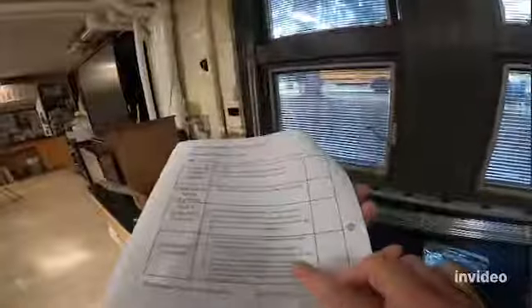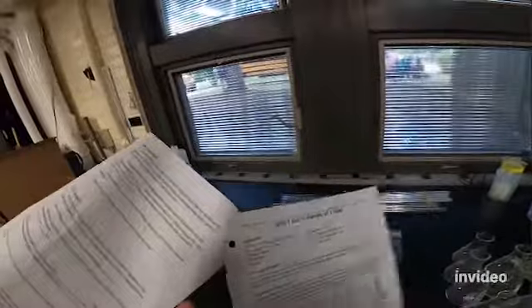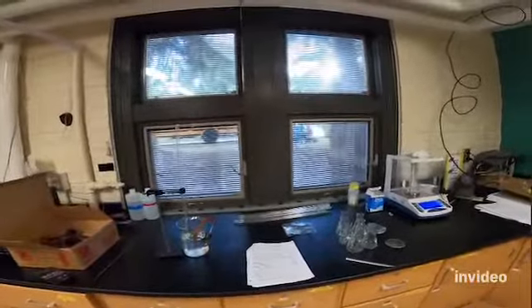Okay, if you're not sure what percent error is, you might want to Google that, and it will show you how to calculate it. Okay? All right, guys, that's the density of a gas lab. Everything you need should be over here, and you guys can do it all on your own.